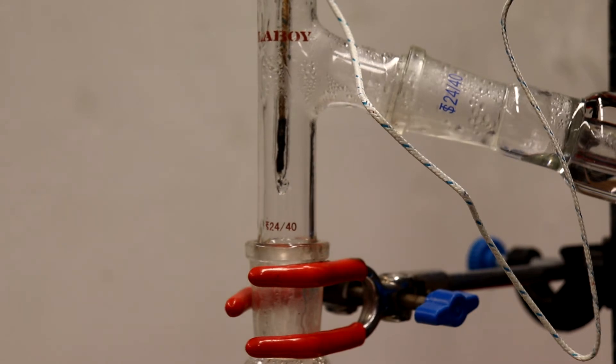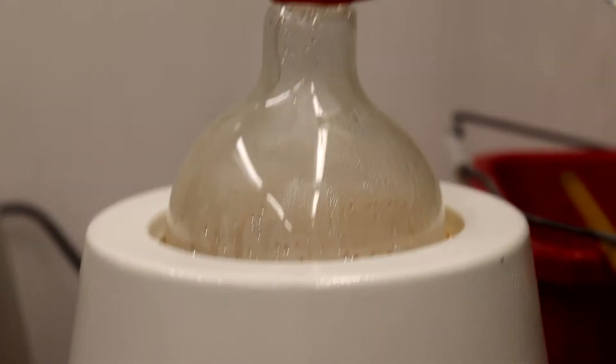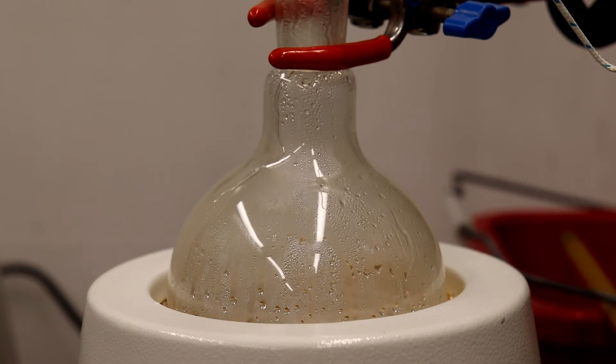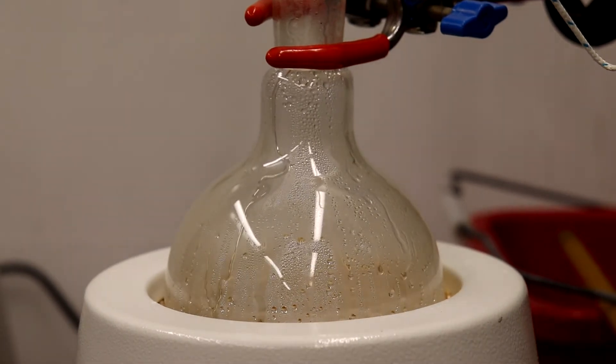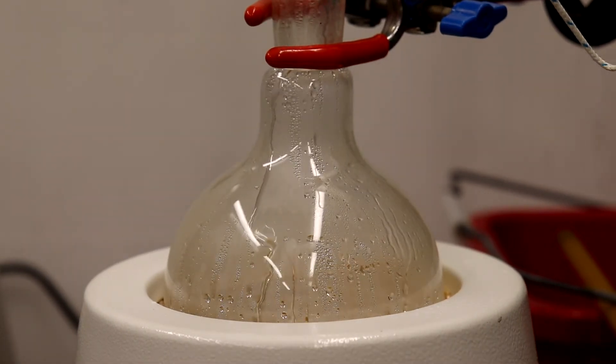So you can see if I move down a little bit, the reaction is going just well. It's all melted into like a tan brown liquid.